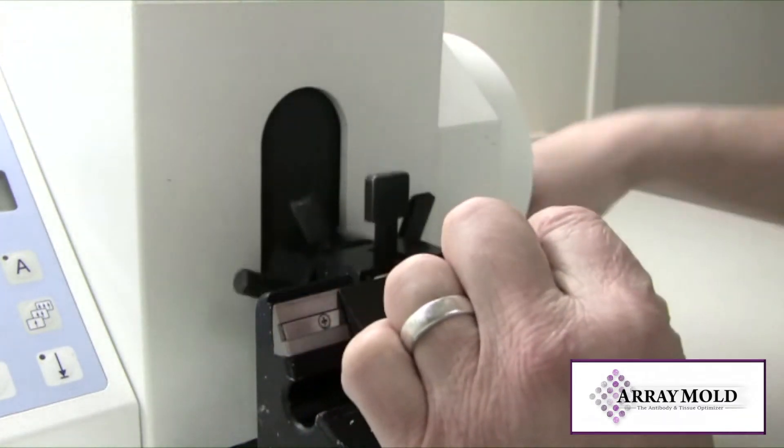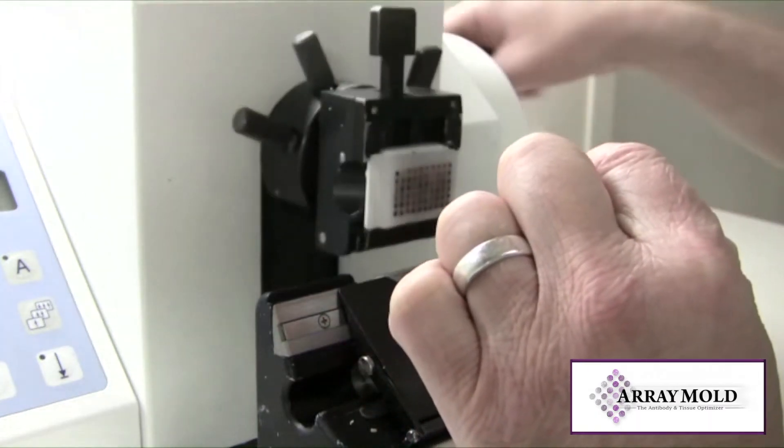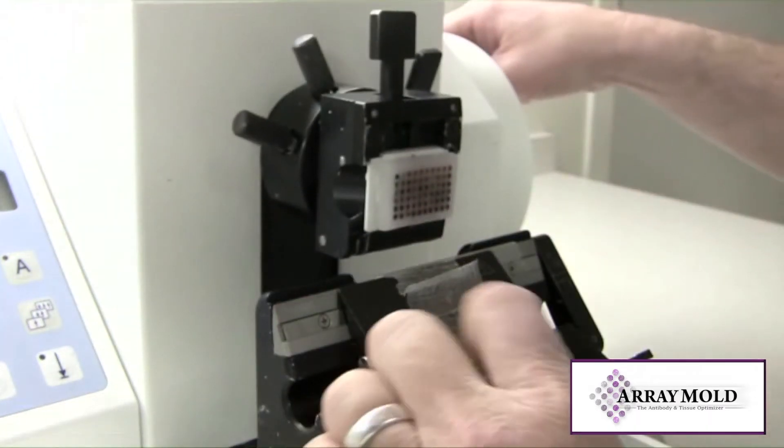Once you have trimmed into the block, put the block back on an ice tray and move the blade to a new area or change the blade.